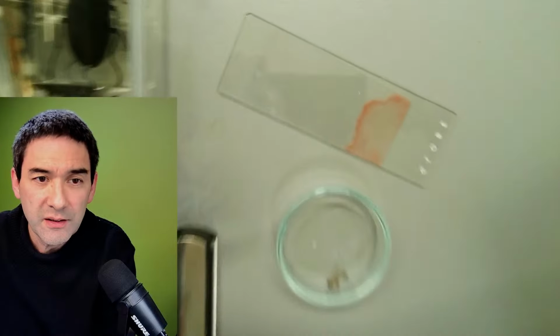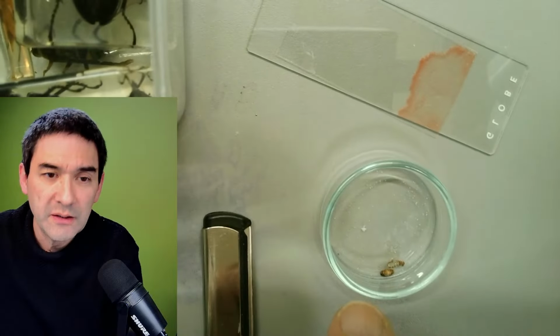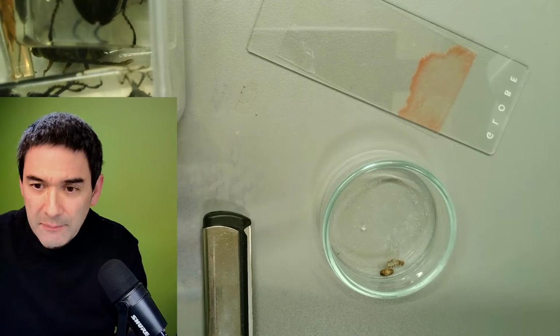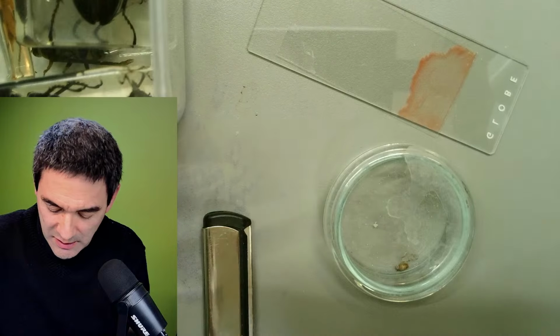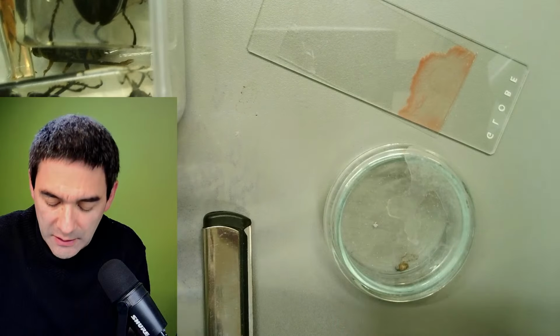So here it is. Let's zoom in a little bit. Okay. So I'm gonna see what it's actually gonna feed on. Right. So that is essentially the first thing. I need to get something, some kind of plaster maybe, but it kind of stopped bleeding already a little bit.